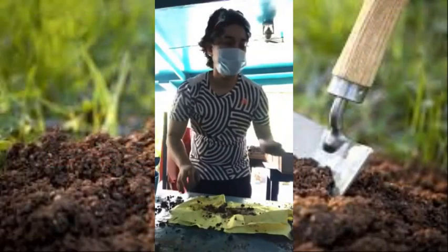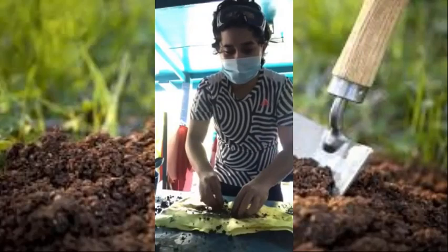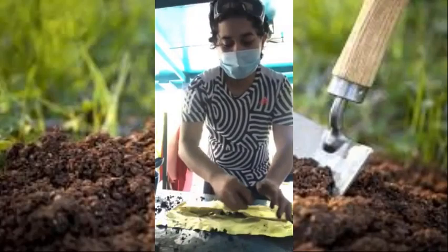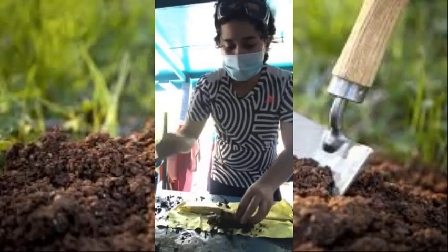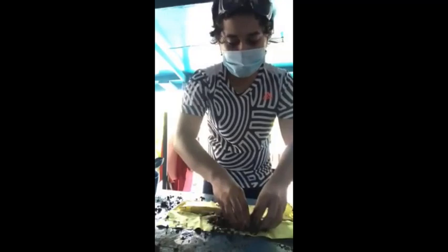Okay, so let's do the experiment. We have our soil sample here, some water, and some protective paper. Just put the soil. So the first thing we're going to do is get some soil and make what you call a ribbon — a ribbon made up of soil by kneading it with our fingers, as stated in the experiment. By kneading it, we're going to put just a bit of water and make a ribbon.